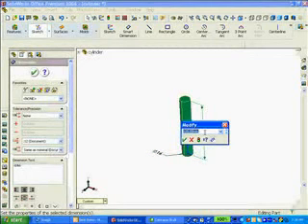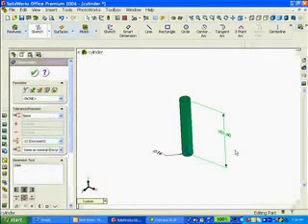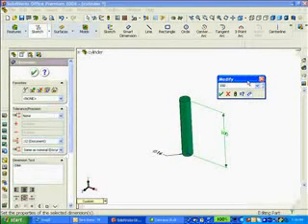Let's say you wanted to deal just in inches. There are 25.4 millimeters to 1 inch. If I select 4 inches, I'm going to be pretty close. Notice that if I put the units of 4 inches in, SolidWorks will calculate for me that that is 101.6 millimeters. If I double click on that and return it back to 100, I get the result I'm looking for, as close to the actual glass test tube that I want to model.